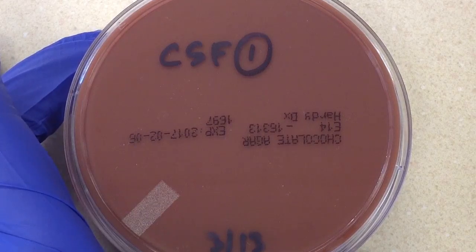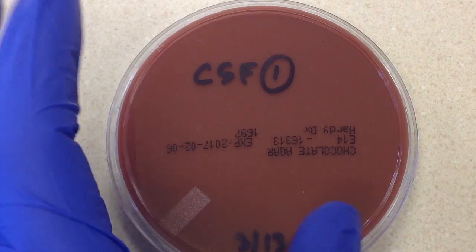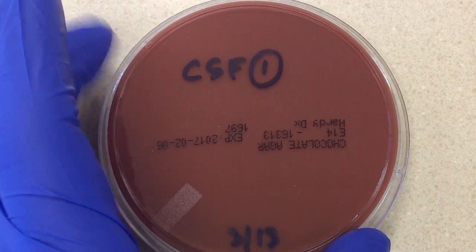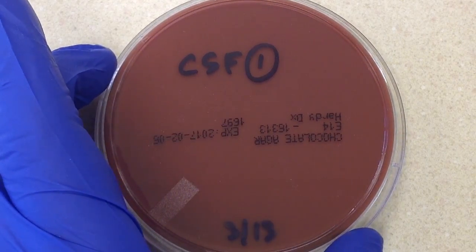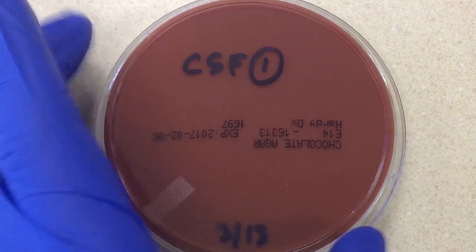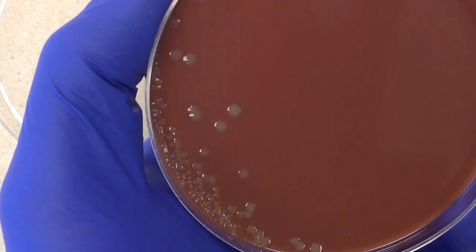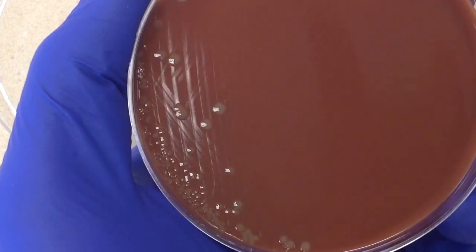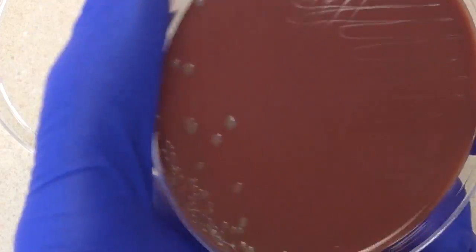Here's our chocolate plate. Students really need to know the function of each of the media set up on cultures and what organisms are going to grow on which plates. We have these grayish, slightly shiny colonies growing after 48 hours, incubated in an increased CO2 incubator.